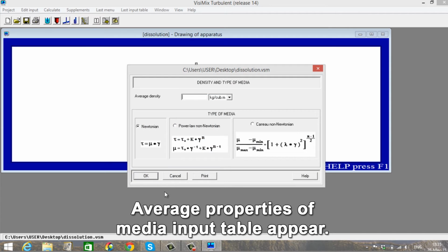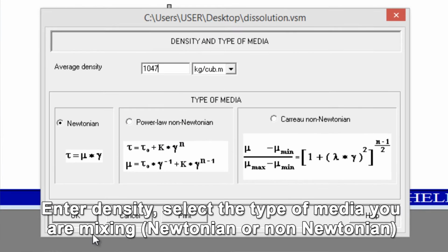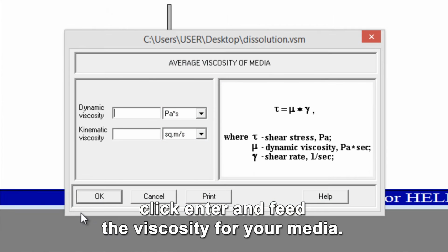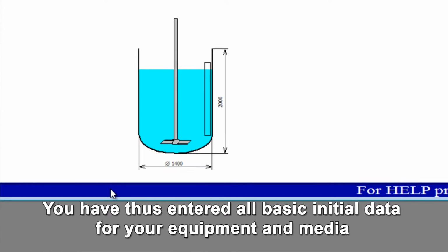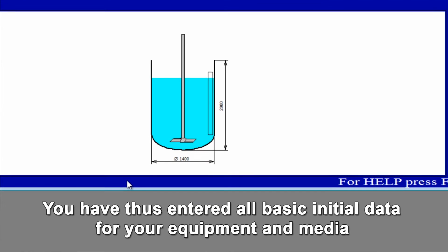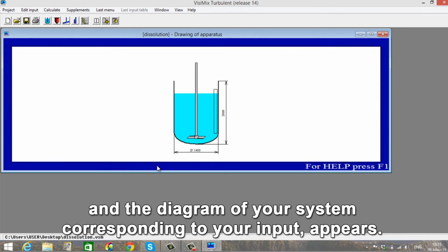Average properties of media input table appears. Enter density. Select the type of media you're mixing, Newtonian or non-Newtonian. Click Enter and feed the viscosity for your media. You have thus entered all the basic initial data for your equipment and media, and the diagram of your system corresponding to your input appears.